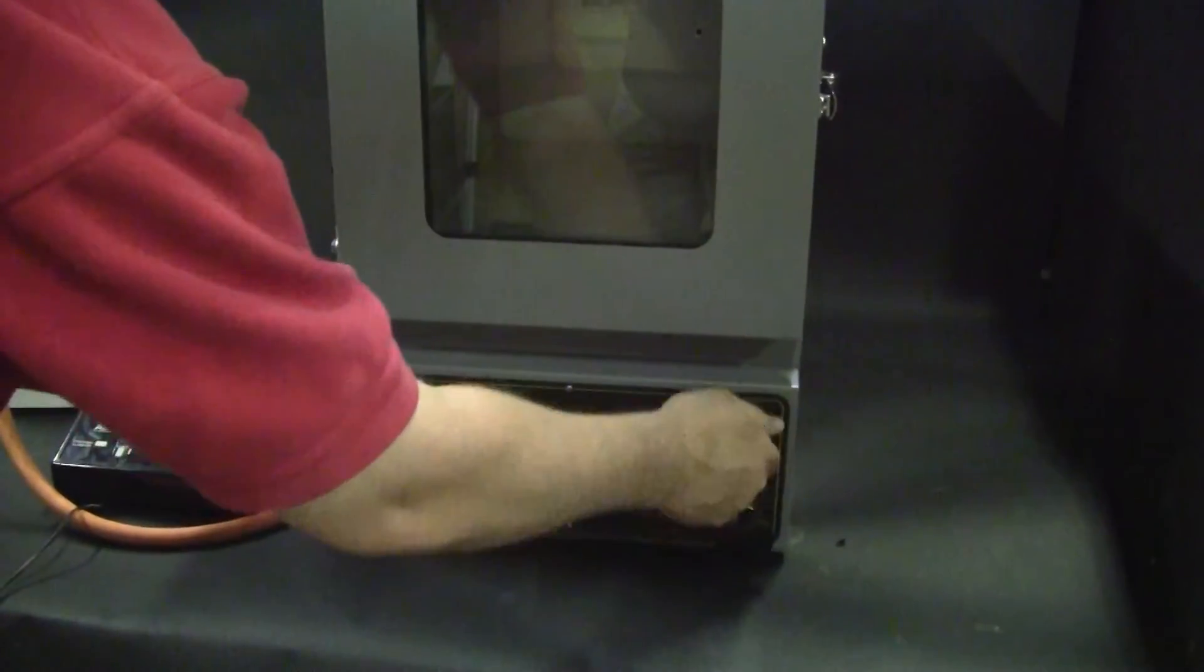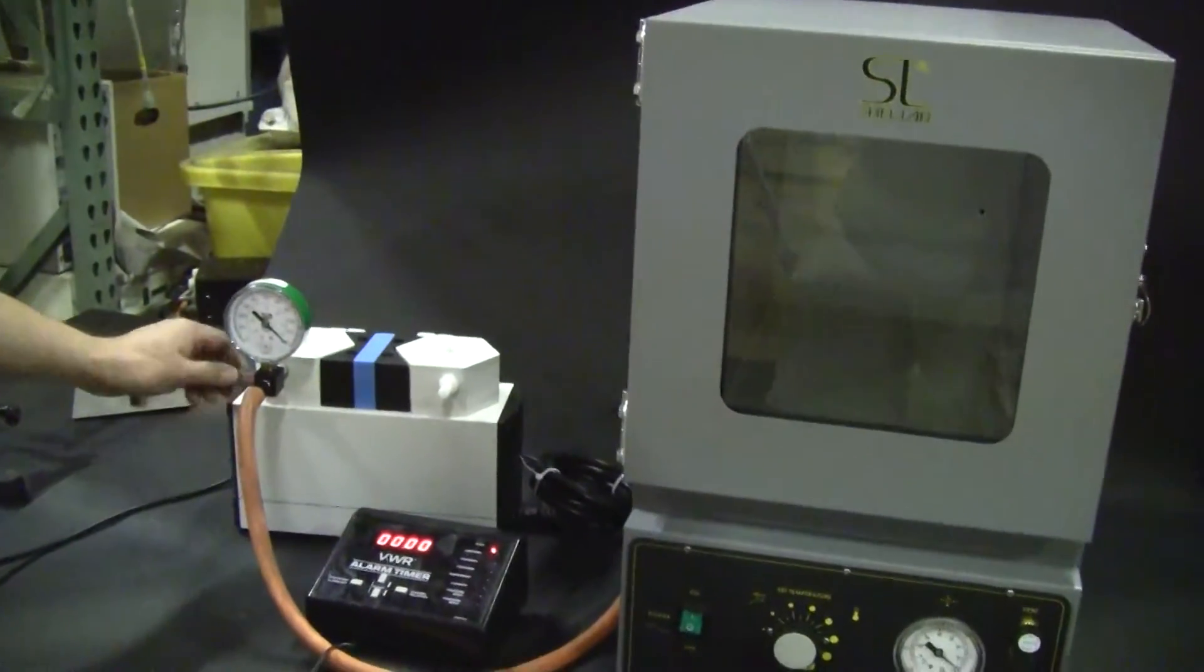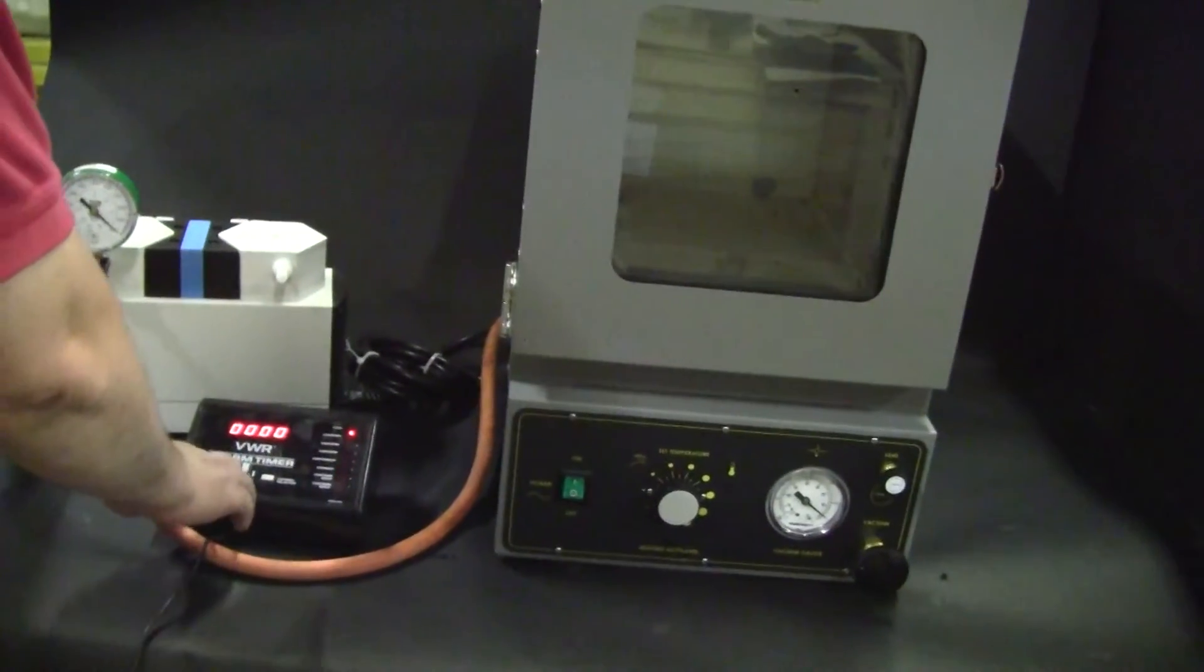Completely releasing it. And so it begins.